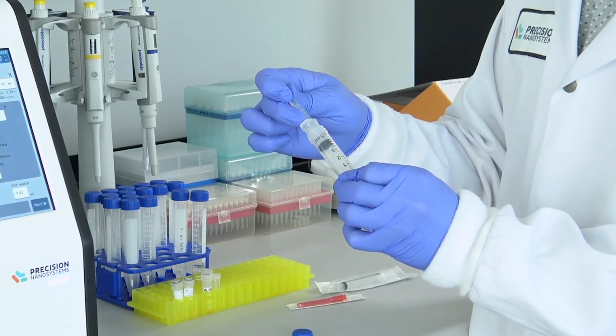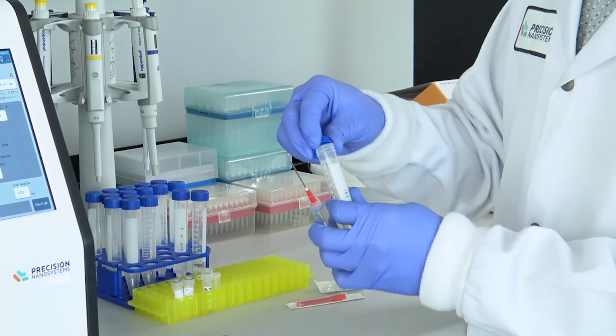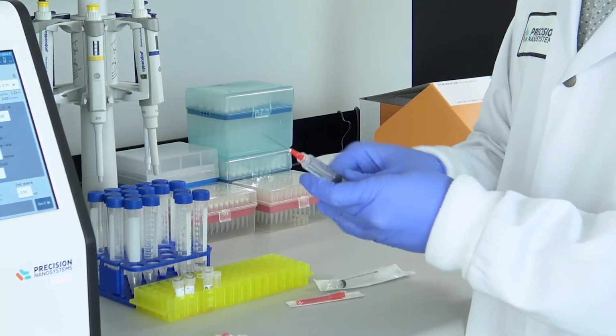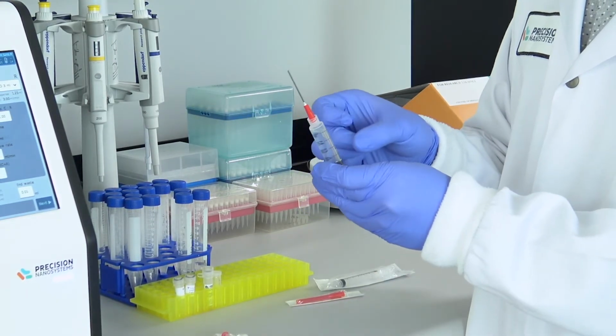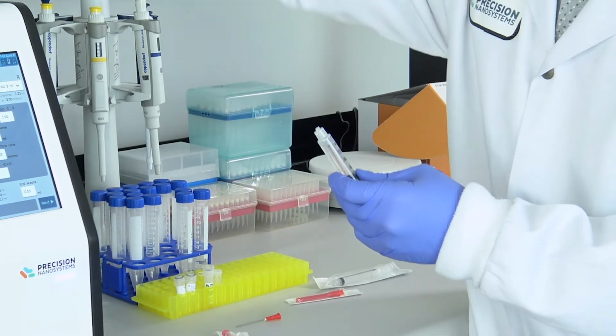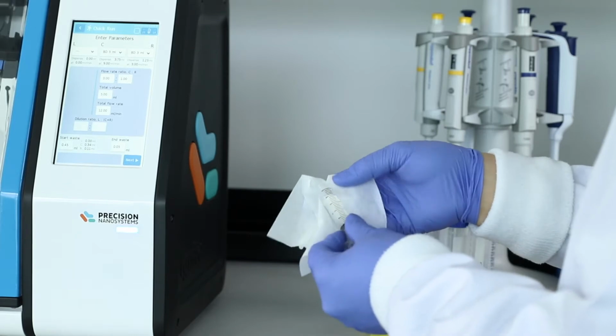Because the same NxGen technology is available across the NanoAssemblr platform, users are able to work with and start developing a process representative of the eventual GMP process. So you're not only making formulations for preclinical studies, you're also getting a head start developing that final process at the earliest stages.